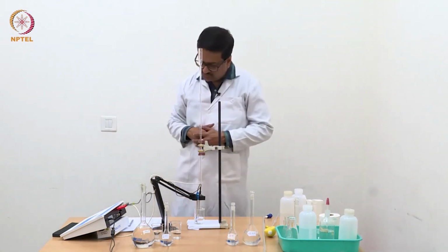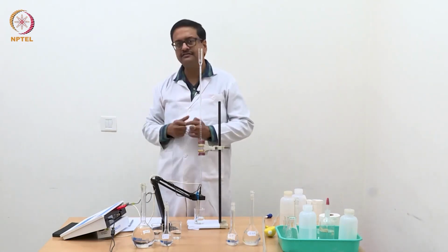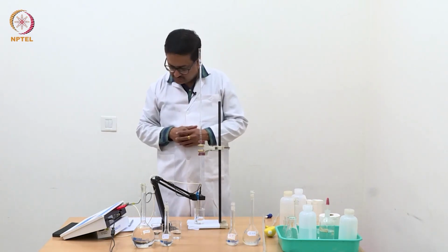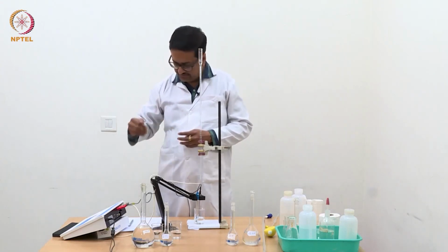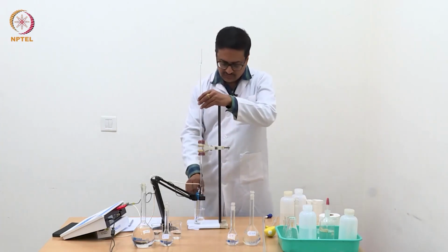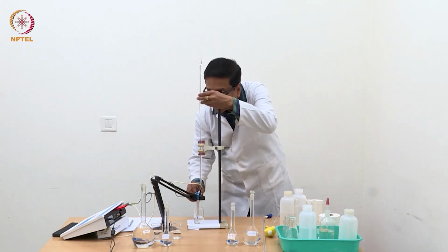Now I have got two more readings, 1.4 ml and 1.5 ml, and I see there is a constant jump in the value of conductance. From 0.385 it has gone to 0.429 and then 0.476. So it is constantly increasing. To be able to draw a good straight line, as I indicated, we need some more points.